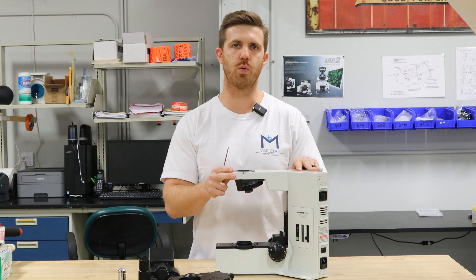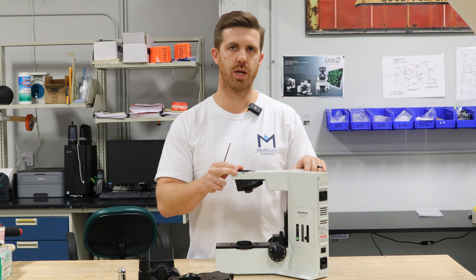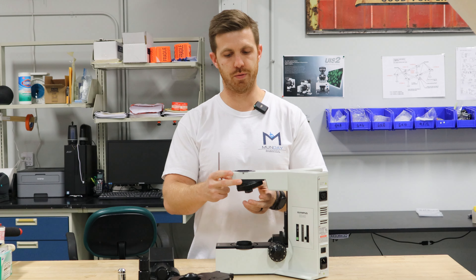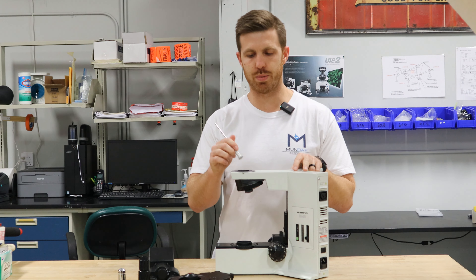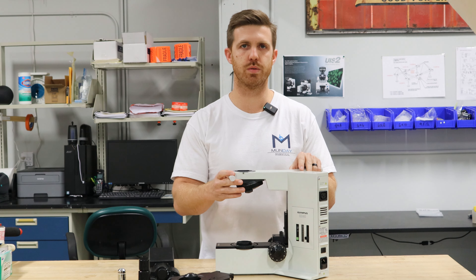The difference between the BX41 and the BX40 that we get asked about a lot is the nose piece. On the BX40, most models, this nose piece will not come off. They do make a few that have a dovetail flange that you can slide the nose piece in and out, but this particular one doesn't have that. That's an add-on product. It's very rare to see those.